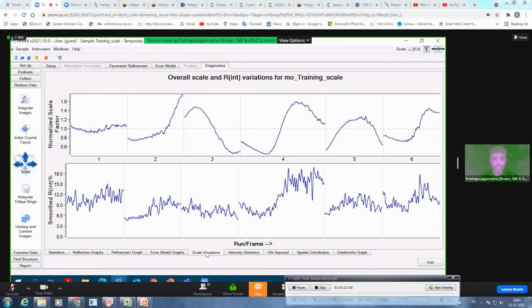If I look at scale variation, on the first run it is okay, but then on the third and fourth run you can see there is a huge diffraction volume change, or the normalized scale factor is changing. That's because your crystal is too anisotropic.